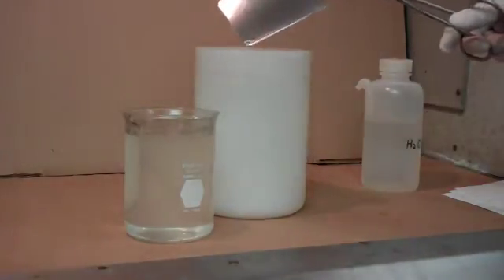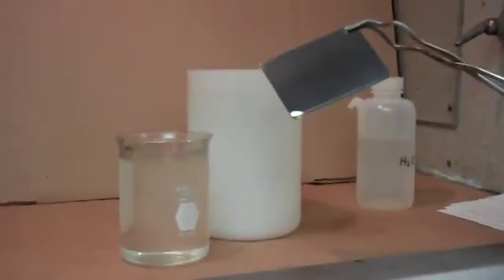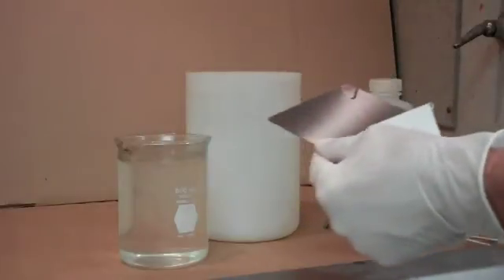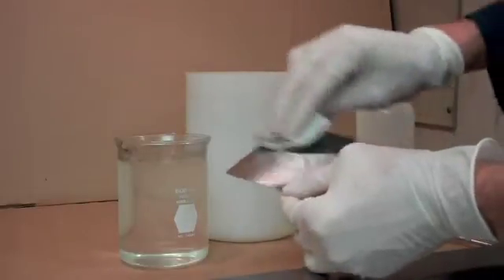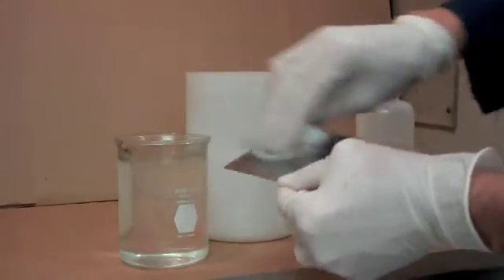Now since this is a highly polished steel panel, there is a little bit of smut on the surface and we want to be sure to remove that. So we will take a damp paper towel with fresh water and we will vigorously scrub the surface of the panel.